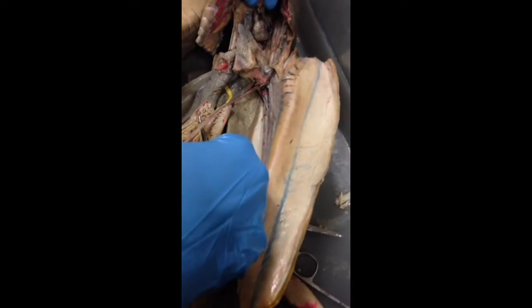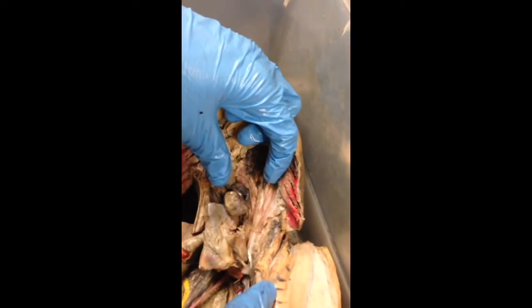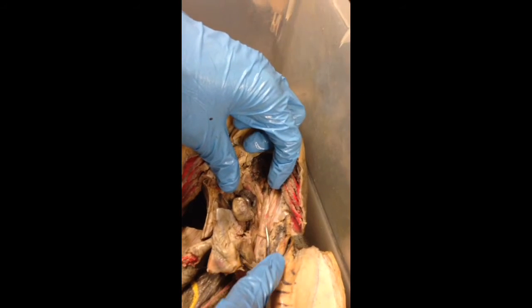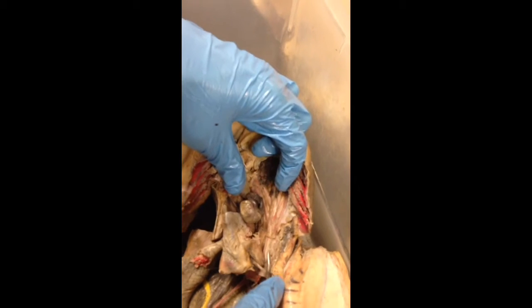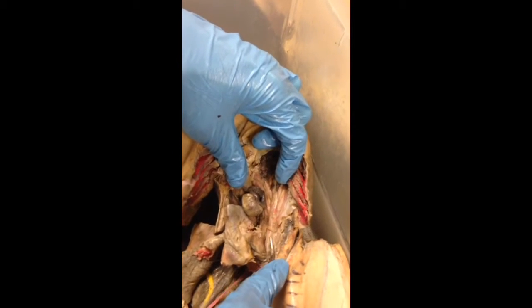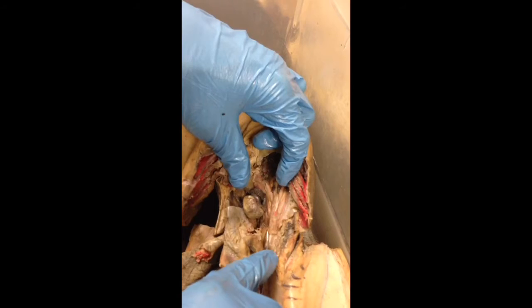Next thing on the list is the dorsal aorta. It's the larger tube that branches out all of the efferent branchial arteries — the central one. It's pretty easy to find on the dorsal side of the organism.